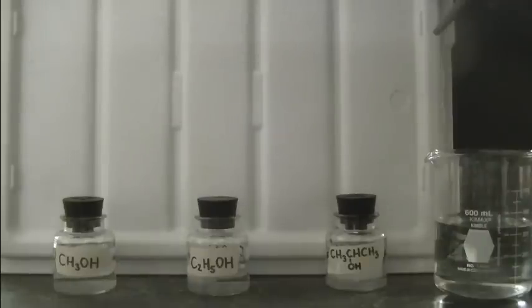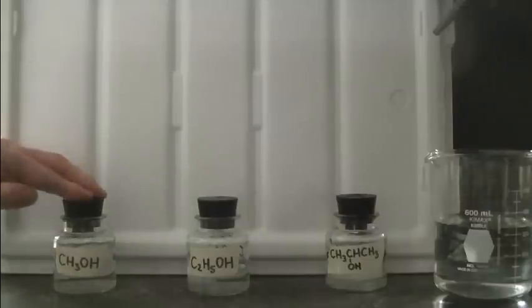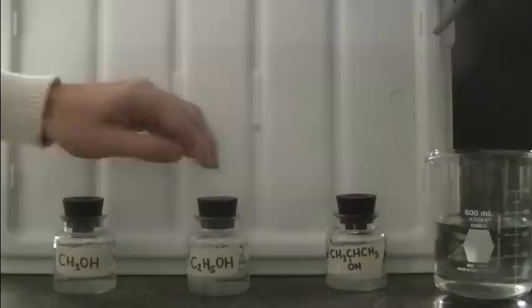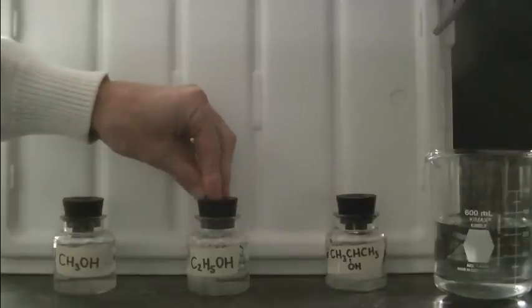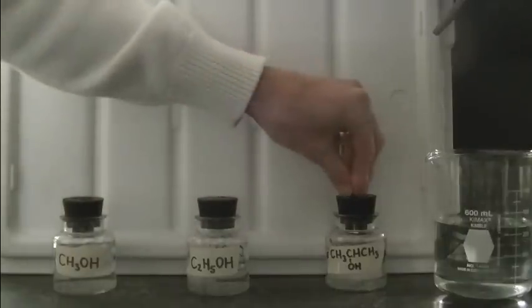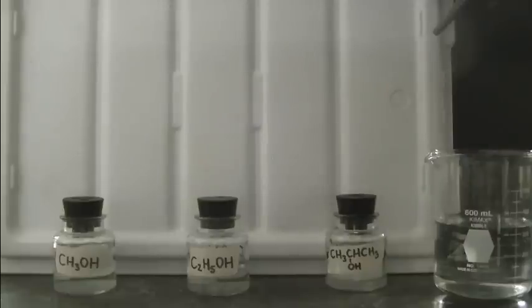I'd like to demonstrate for you the effect of increasing numbers of carbon on the combustion of alcohols. So I have three alcohols here with increasing number of carbons. I have methanol, a one-carbon alcohol, ethanol, a two-carbon alcohol, and isopropanol, a three-carbon alcohol. We're going to combust all three of these and observe the similarities and differences upon their combustion.